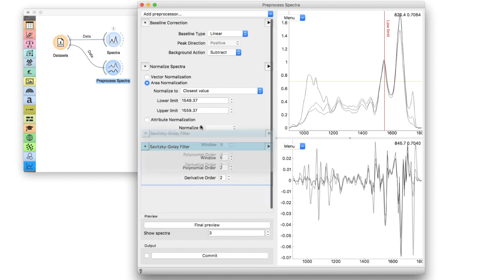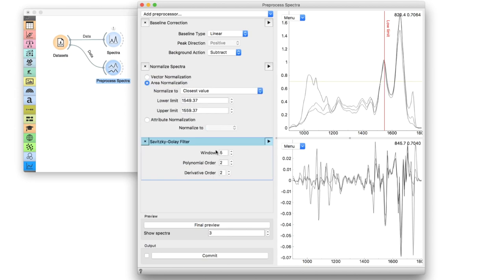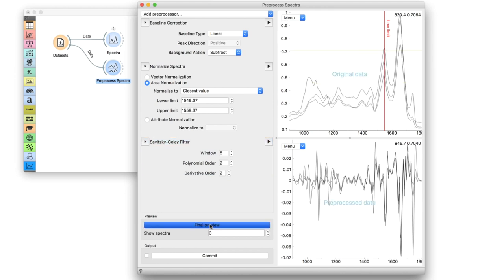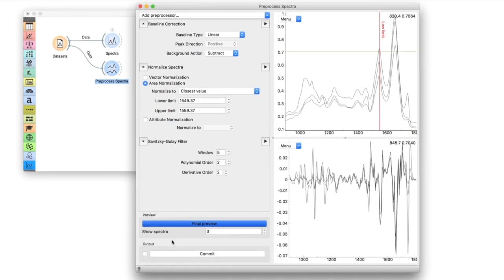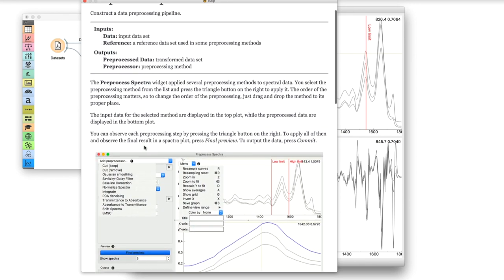You can also reorder preprocessors to explore and tune their effect on the final result. Be careful, as the order can be quite important and can affect the final result of the analysis. To see the final output, you can click the Final Preview button. This shows the original data at the top and the final data with all the preprocessing steps applied at the bottom. Of course, there are multiple options in each preprocessor, and we encourage you to explore their effect as well as try other methods. You can also read help for more detailed information and examples.